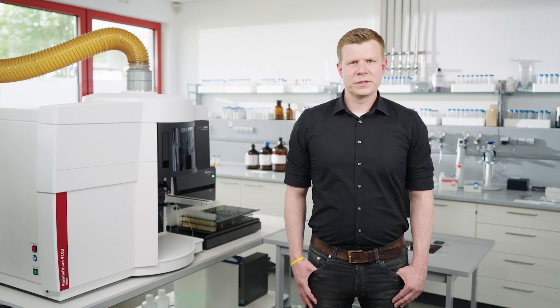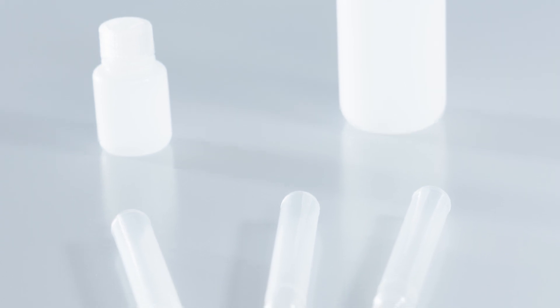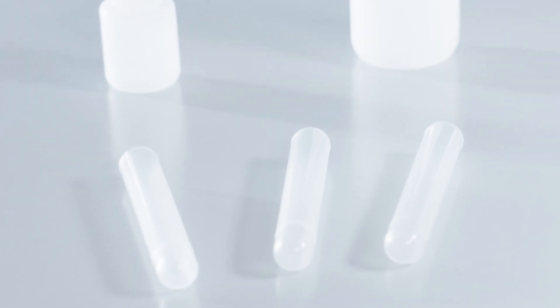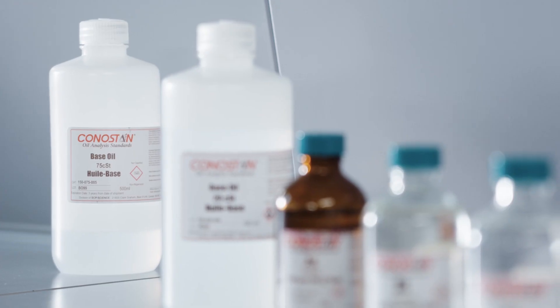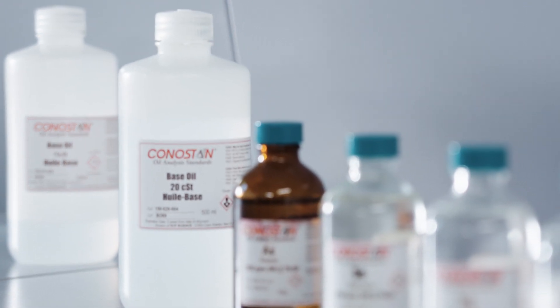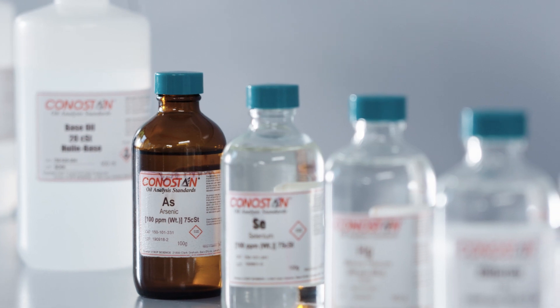Solvent resistance of the sample vials is a very important topic when working with organic dilution. Common falcon tubes are not recommended here. If necessary, use glass vials or an appropriate plastic material. For trace element analysis, elements that may leach from the container material pose a critical issue, since they can contaminate the blanks, standards and sample solutions. As for the solvents, it is recommended to test the vial material before use as part of the method development.